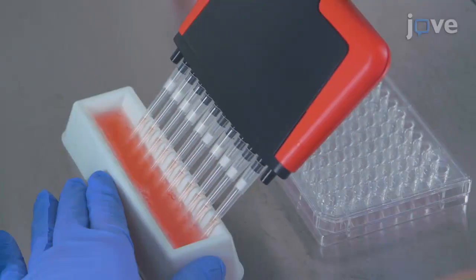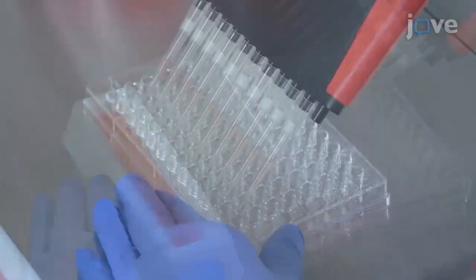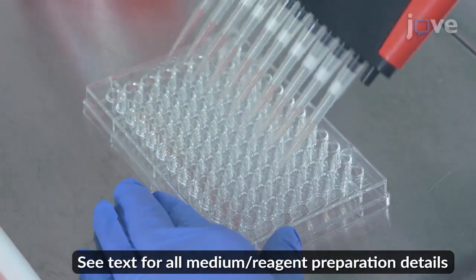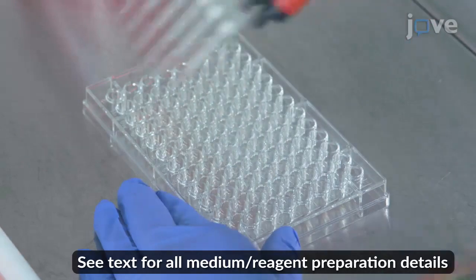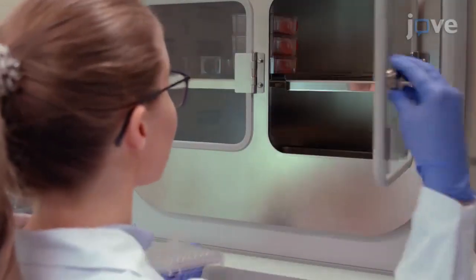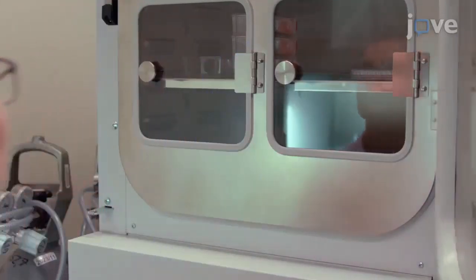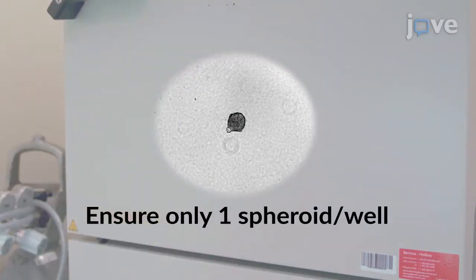For multicellular tumor spheroid generation, dispense 1 × 10³ cells from the cell line of interest in 50 µL of complete medium into each well of a 96-well ultra-low attachment round bottom plate. Then place the plate into a 37°C and 5% carbon dioxide cell culture incubator for four days before visually confirming tumor spheroid formation with an inverted microscope.